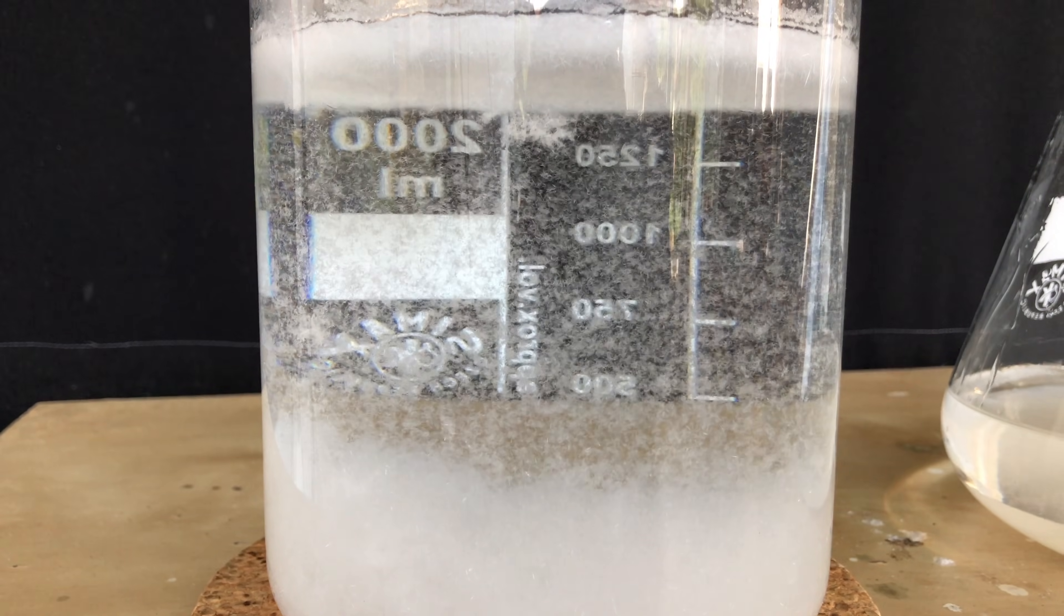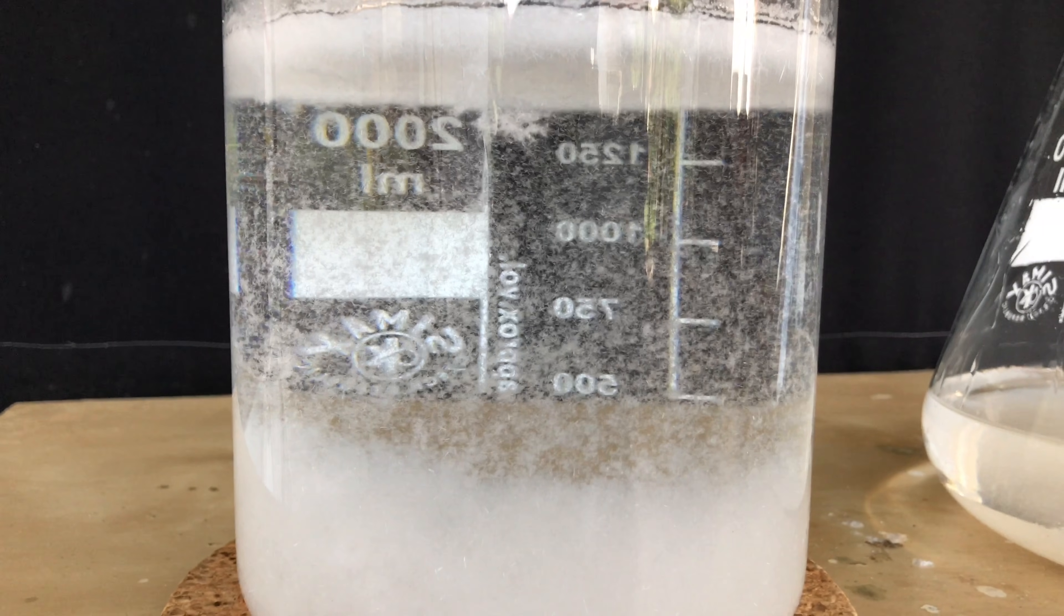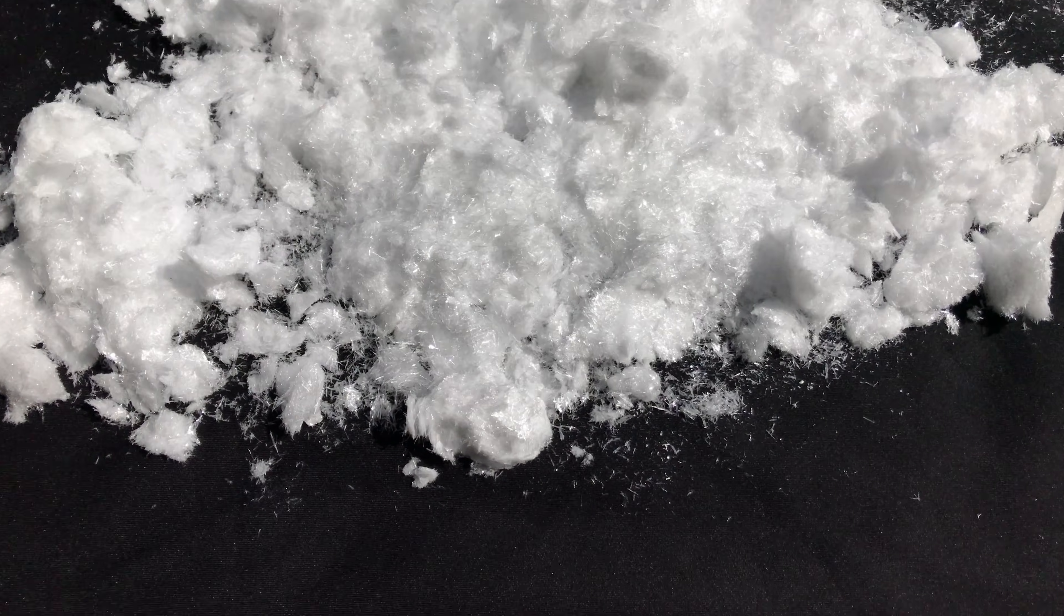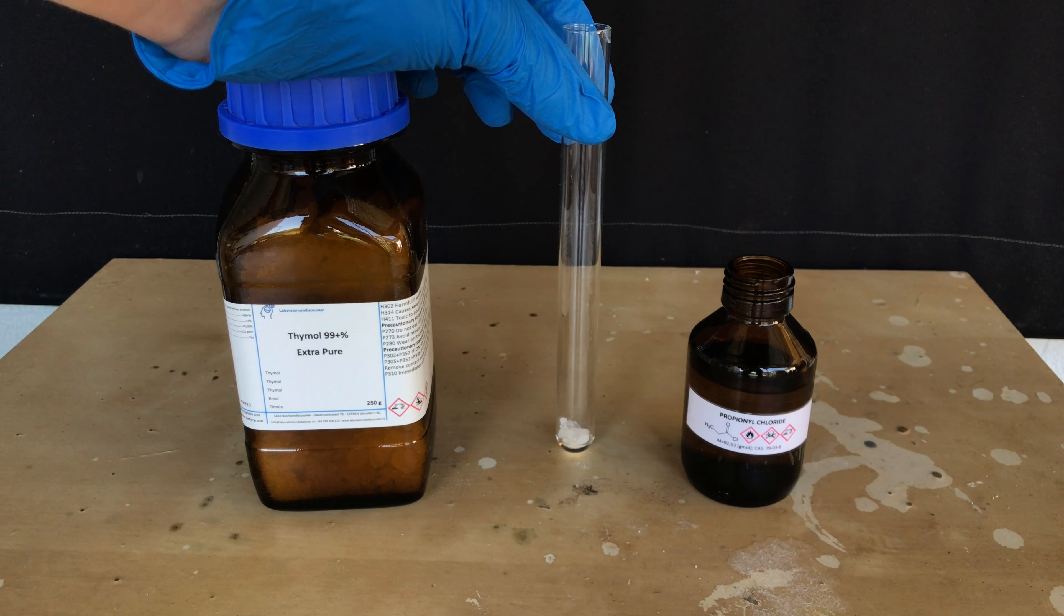Watching benzoic acid crystallize out is also mesmerizing, it looks like a snow globe. We ended up recovering 196 grams of benzoic acid, so this does not have to go to waste and can still be used for other projects.